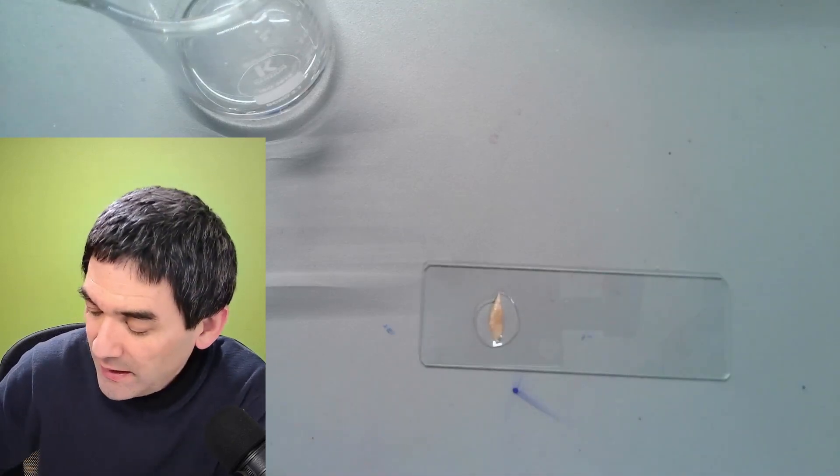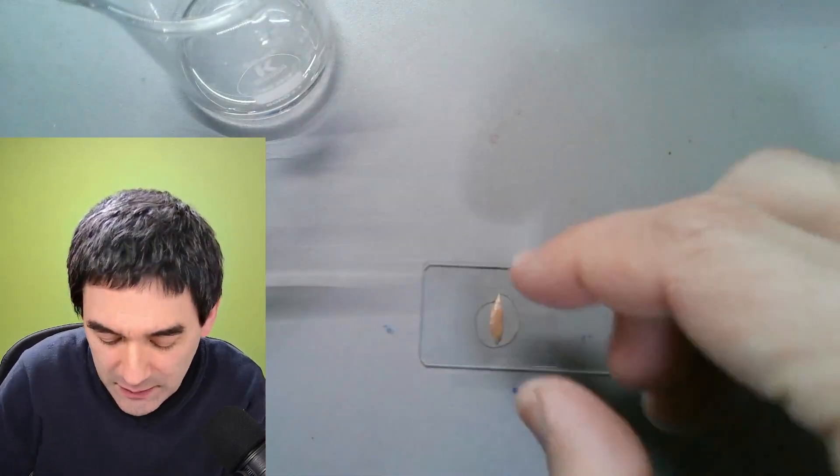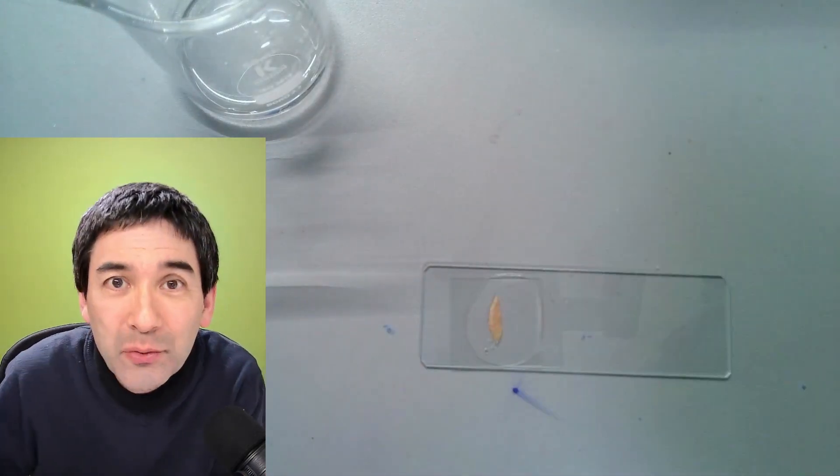And then at the end I have to of course put a cover glass on top and essentially that's it. Maybe we press a little bit and we're ready to go.